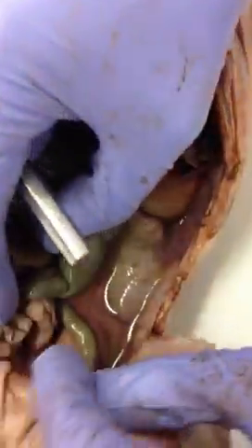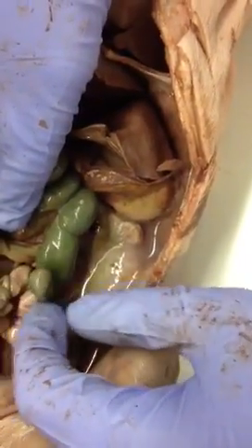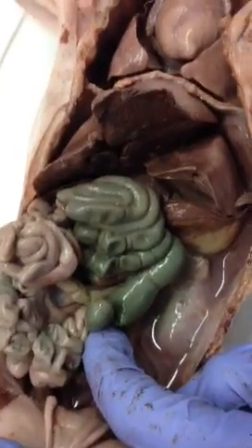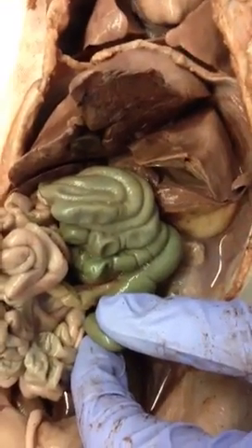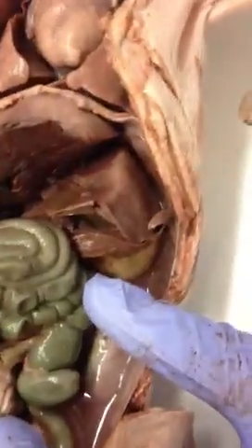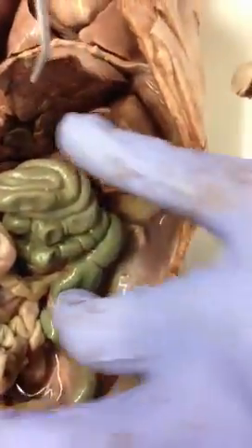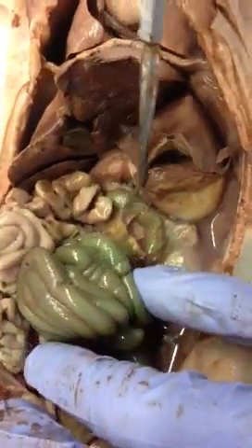It comes around, and this lobe-ish thing is the cecum. Transverse is one piece — this is transverse, and then it goes down. This is the cecum. And then this is the ascending loop of the colon. I think this is still part of the ascending coil, and it comes up here before it descends.